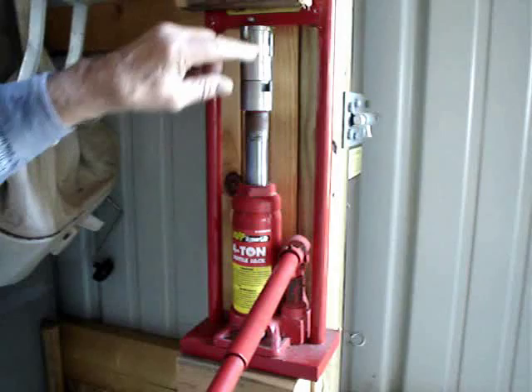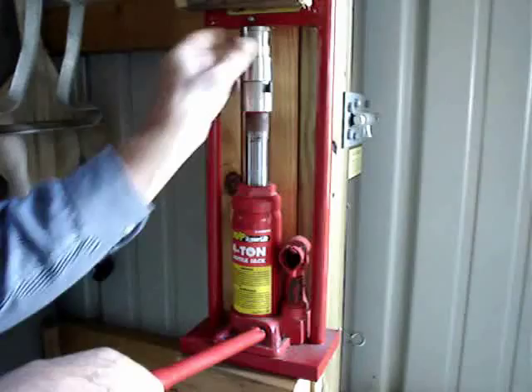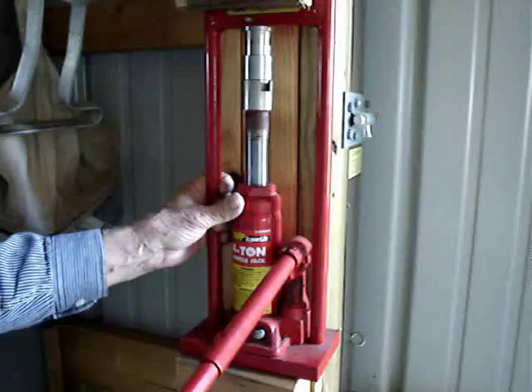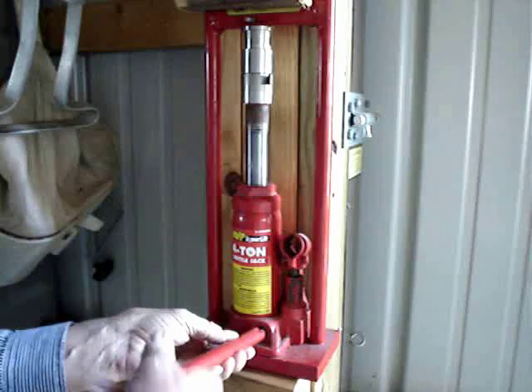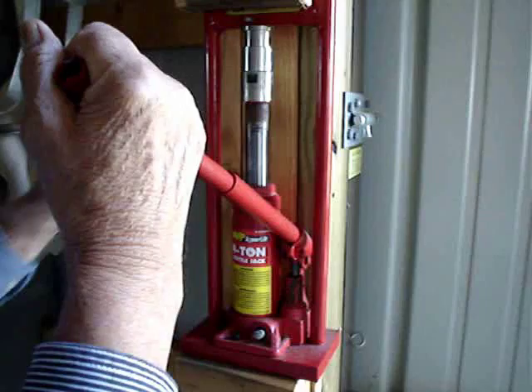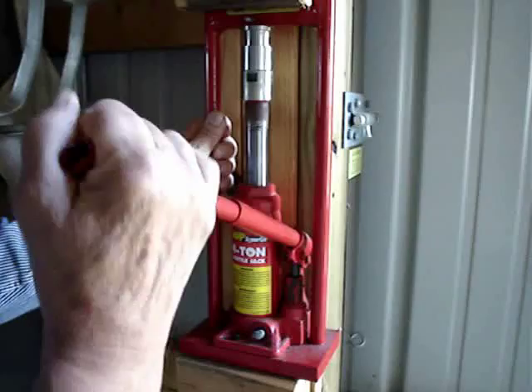All of the grass has been pushed down into this second chamber which has a screen on the bottom. I'm going to loosen just enough to get this snap ring — snap fitting, snap whatever you want to call it — off. Now at this point the second piston can go down, and as it does we're hoping to get a little juice. We don't want to get too carried away here. We can literally crunch that stuff where the whole sample goes through this second piston, but we don't want that — we're really after the juice. So we're going to put pressure on, but we're not going to get carried away.